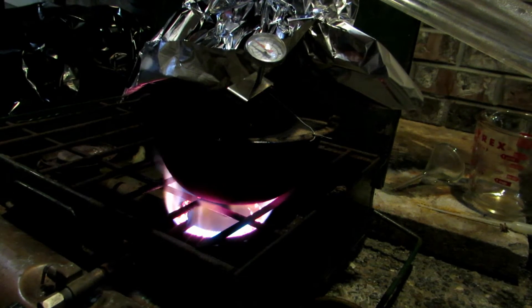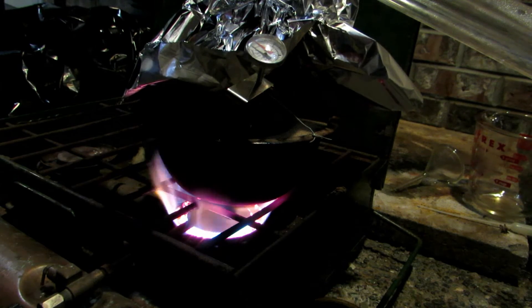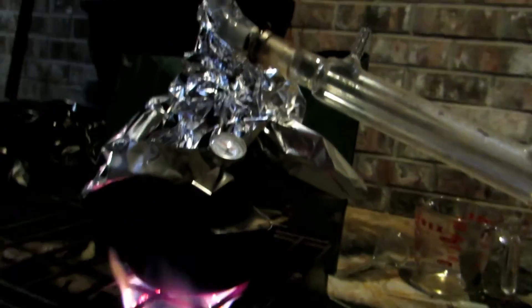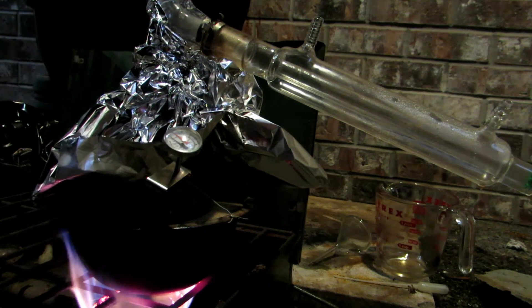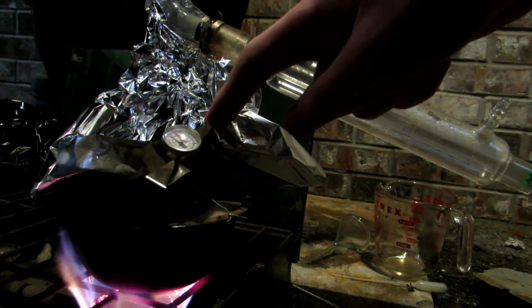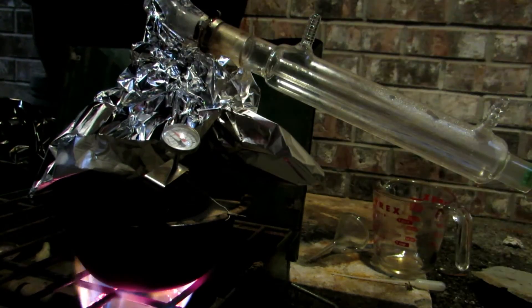It's been outside for almost an hour now, heating really strongly, and the flask has just begun to boil nicely. I added some sand into the boiling flask so that less bumping occurs and we get a nice even boil. We're starting to actually condense stuff — over in our receiving flask we're getting a couple of drops of liquid coming over. The first 25 milliliters or so will just be water because our sulfuric acid is about 90% concentration. After that, we'll bring over another 5 milliliters or so, then switch out the receiving flask and start collecting pure sulfuric acid. The temperature is well over 300 degrees Celsius, despite this only being a 100-degree Celsius thermometer. The sand bath has gone around the thermometer scale about three times, so I'm assuming it's somewhere over 300 degrees Celsius.